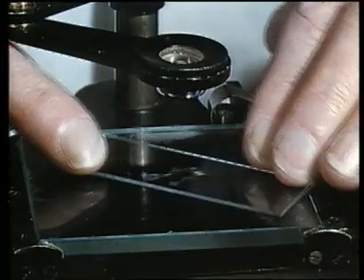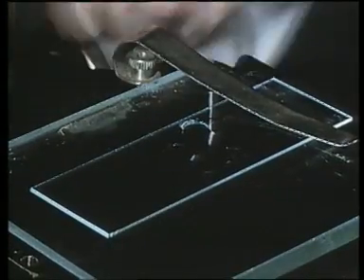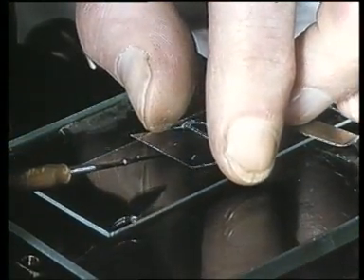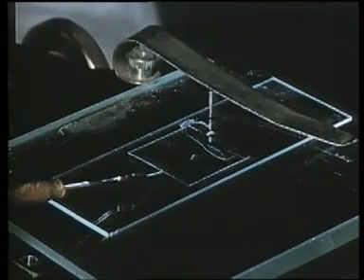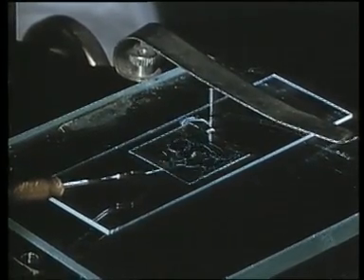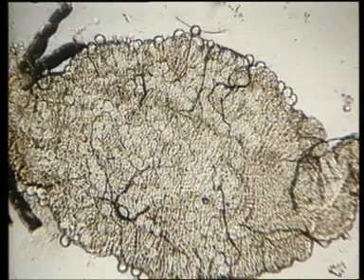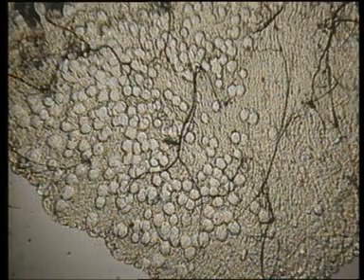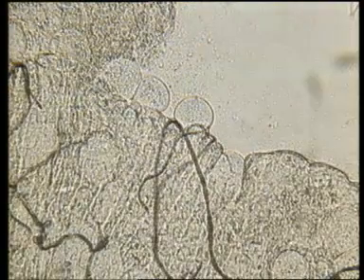The slide is turned round and the malpighian tubules cut off. A coverslip is lowered very gently onto the specimen, just to flatten the stomach without breaking it. The slide is transferred to the ordinary microscope and examined under the low power. Oocysts are seen as tiny, translucent vesicles on the stomach wall. The specimen is heavily infected, and the oocysts are well-developed and easy to identify.